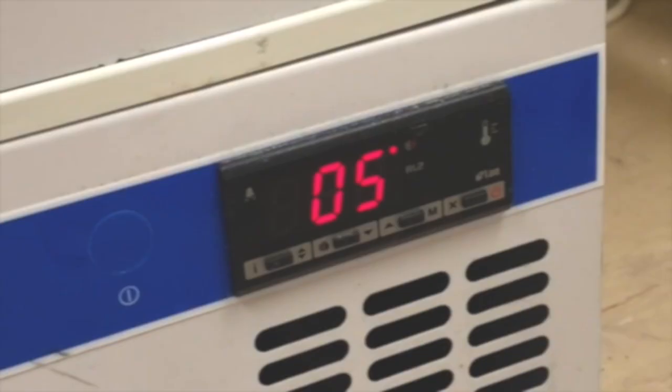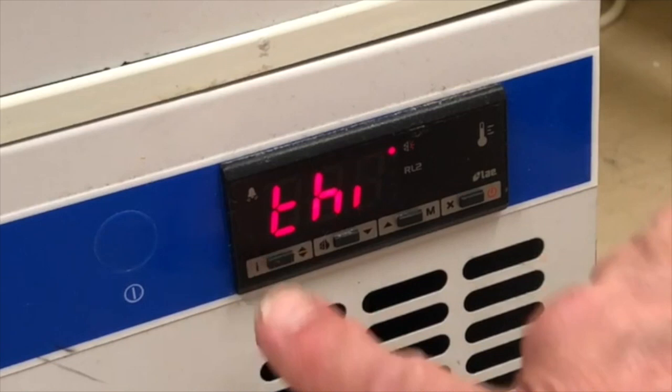For this one, press the I button. THI will appear on the display. Press and hold this button again to display the maximum temperature. Record the number.